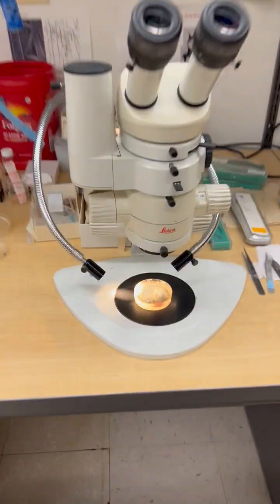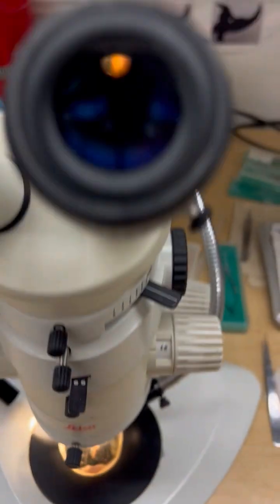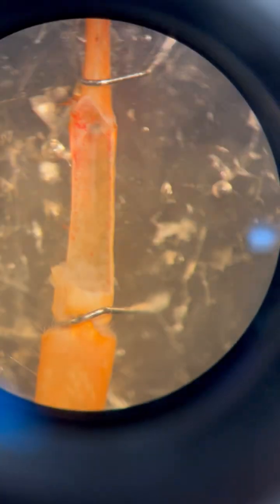And then also so they could see the opener muscle in the crayfish, we have one dissected here, and that's why people have been using this preparation for years, like people at Harvard Neurobiology Medical School have been using this for quite a bit to understand synaptic transmission, and Bernard Katz. It was first described in the anatomy of the opener muscle in 1888 by a German group with methylene blue staining.